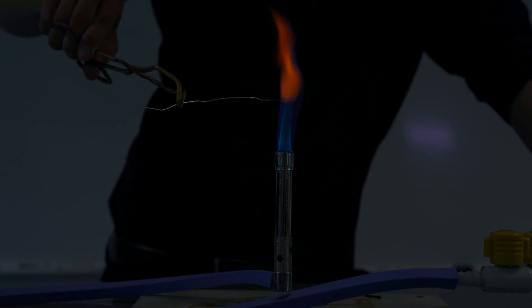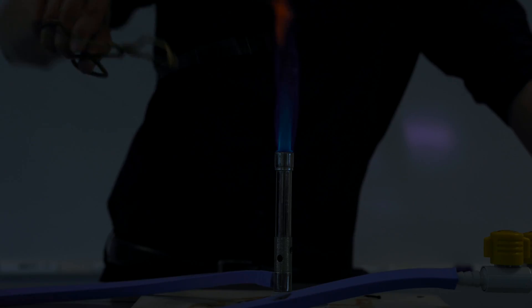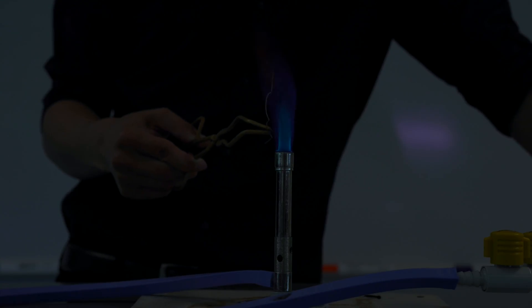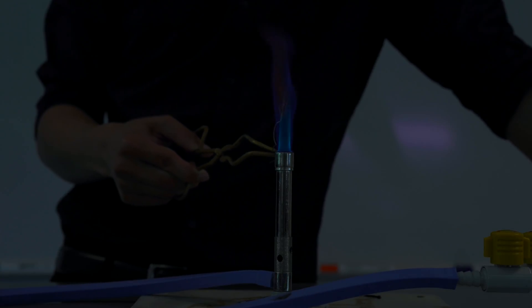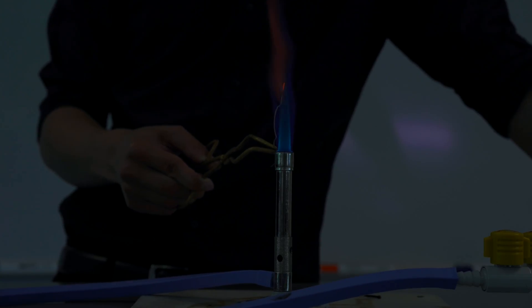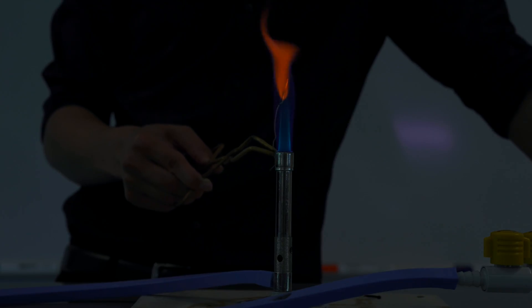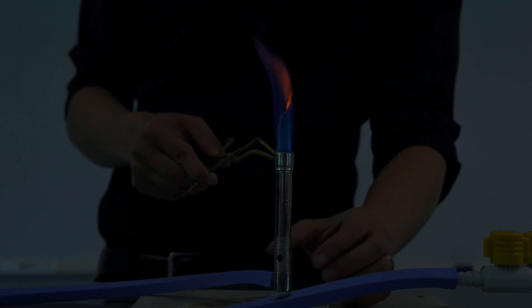Okay, it went black. Continuing — is it on fire? No. Remember in the video about chemical reactions, I said there were five clues to tell if it might be a chemical reaction taking place. I can clearly see it's changing color — hopefully you can too from that far away. It's going orange and it's glowing now.